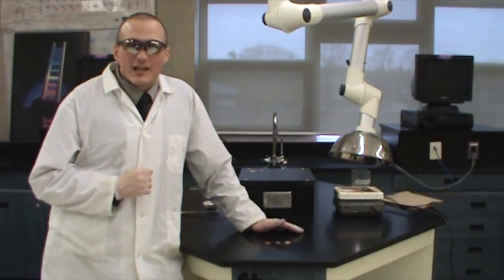Here are the pennies in their Olympic state. So that is the demonstration of electroplating copper pennies with zinc. Thanks for joining us today here in Chem Class.